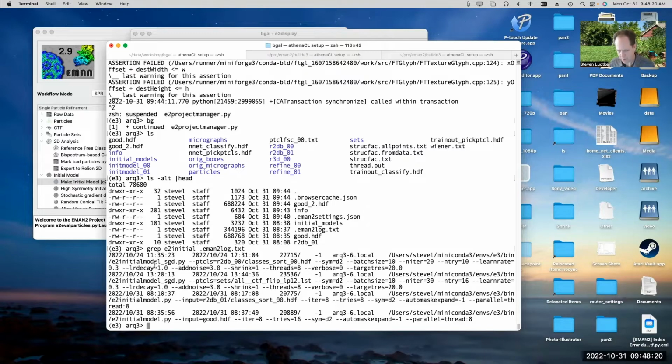So you can see the first time I ran the program, I used classes sort 0, 0. So that was all of the class averages. Then the second time I ran the program, oops, sorry, this is the other initial model generation program. So I ran the other one first, and then I ran the new one. So the first time I ran the old one, I used all of the class averages. And then the second time I used the selected ones.